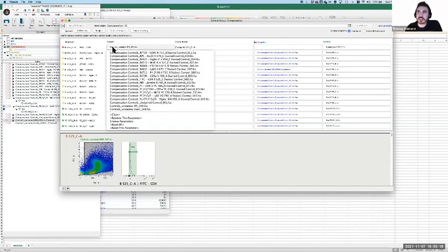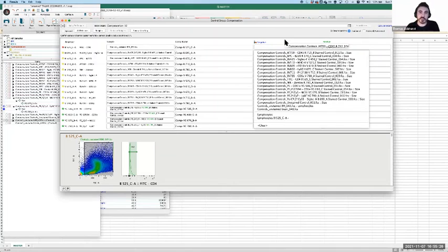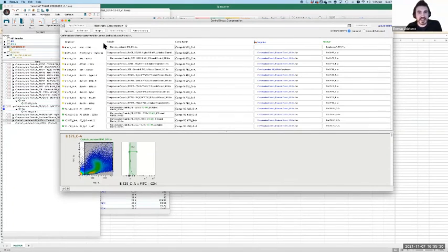That would actually work, because I guess it would have to be stained with something. So maybe not unstained, but I guess you just pick the top and the bottom half of the unstained population and that would probably work. In theory that would let you do it, because basically that row for FITC's contribution to everything, you just turn back to 0, and then you'll have a FITC column, which will be only the contribution of everything else into the FITC detector. So that would work. Can you quickly try that?